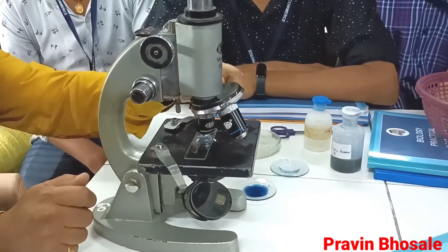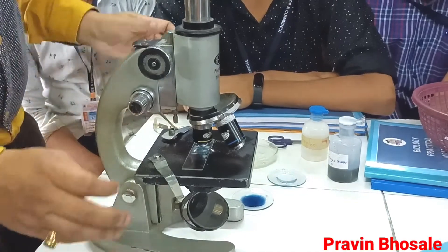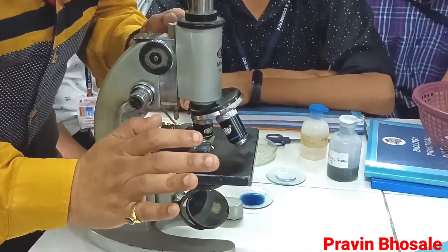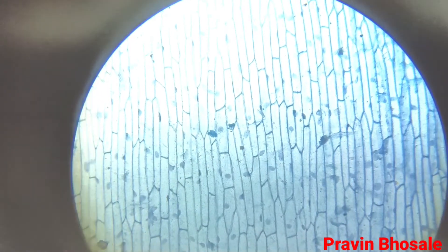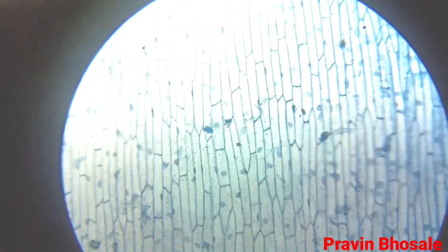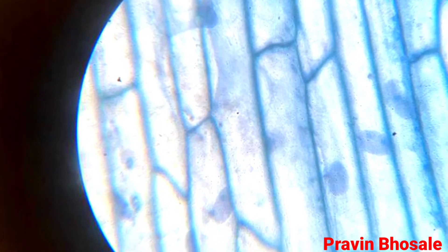Now next is adjustment of the microscope and adjustment of the slide. First of all adjust the light. Keep minimum distance between the object and objective, and move the body tube in the upward direction. Now let's see through the eyepiece. You can see the coloured particles — the coloured dots — these are all mitochondria. I have seen this under low power. Under high power, all these blue coloured dots are mitochondria.